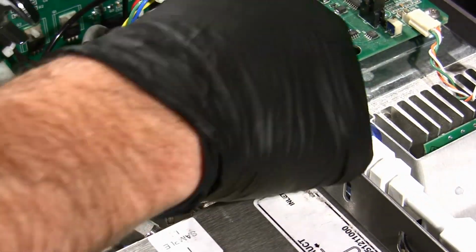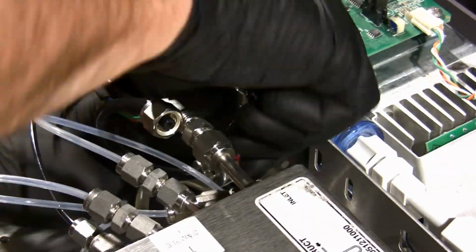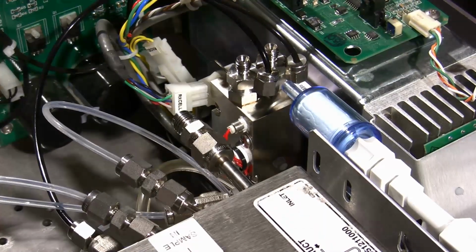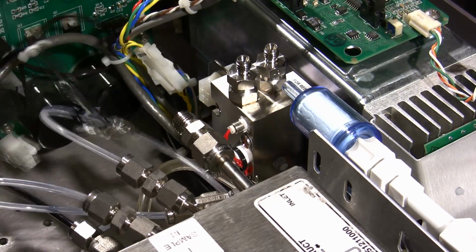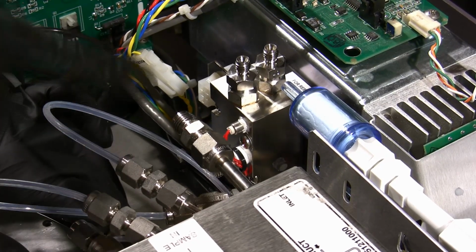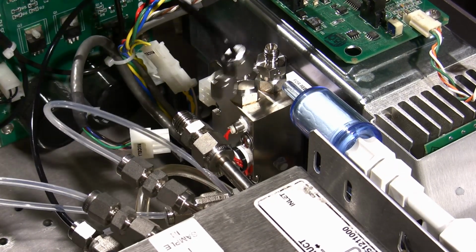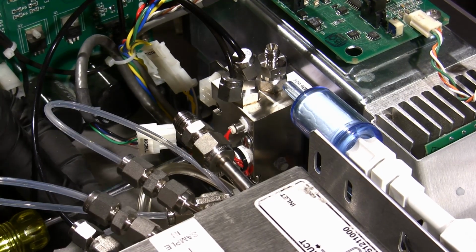So we're going to get a couple wrenches in here. This is all SAE. Most of the tubing in here, if you've got a 7/16, a 1/2" and a 9/16 wrench, you'll be all set for any of the pneumatics that you need to take off around here. Got that out. We've got this out. That's a little bit in the way, but we'll be able to work around it. So we've got 4 Phillips head screws holding this guy in. 2 of them are going all the way through, and 2 of them are going part of the way through. I'll grab my Phillips driver, and we'll get those screws taken out of there.